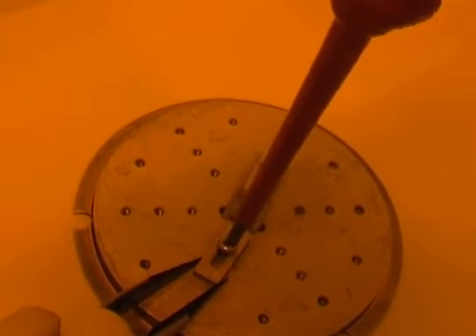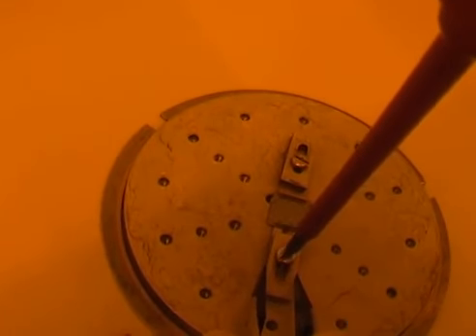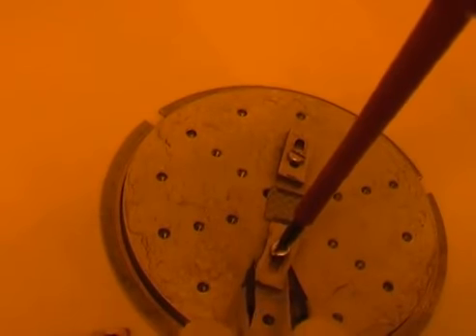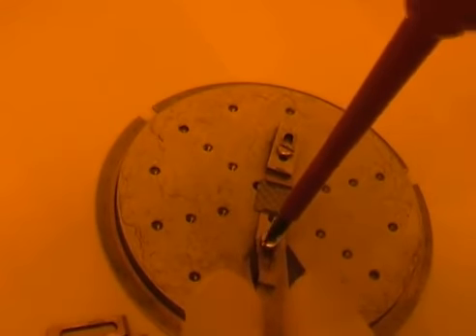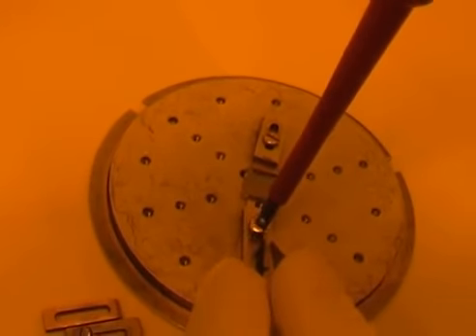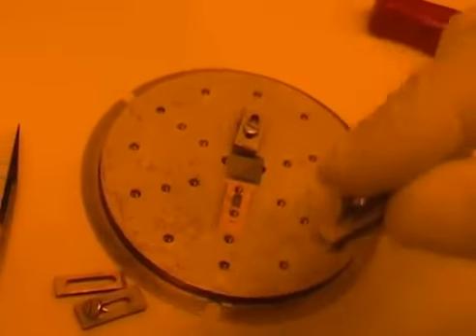I can actually tighten it and leave it on the holder and then put it in the drawer like that, or, as I'm going to show with this other clamp, I can remove it completely and put it in the box of clamps and screws, which is this one.